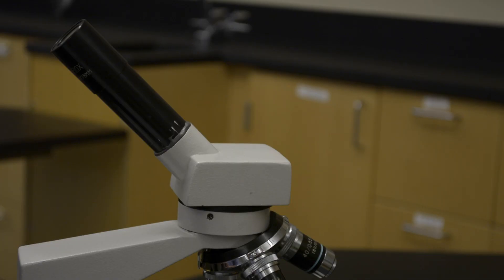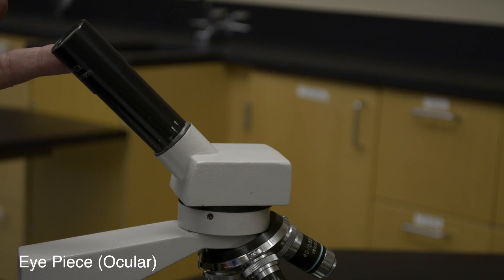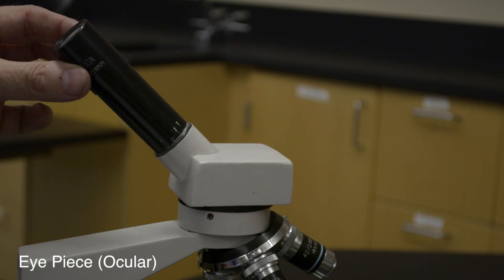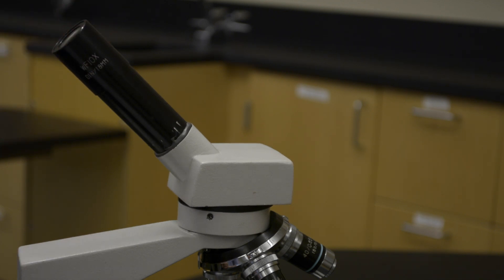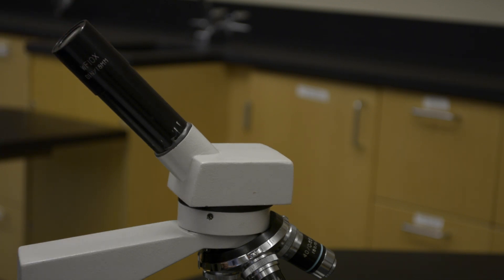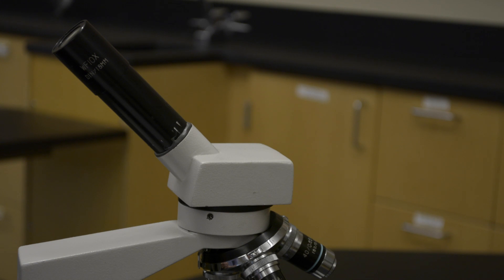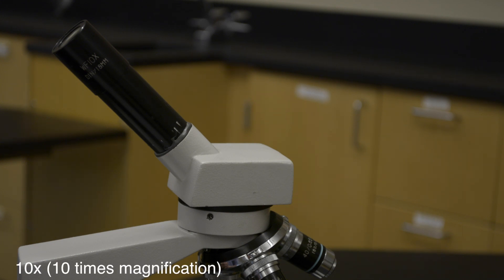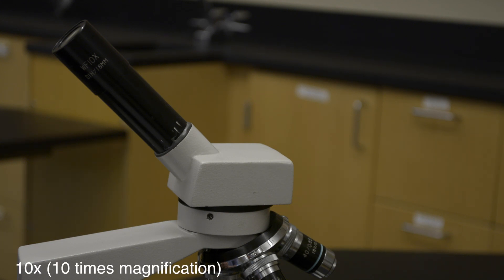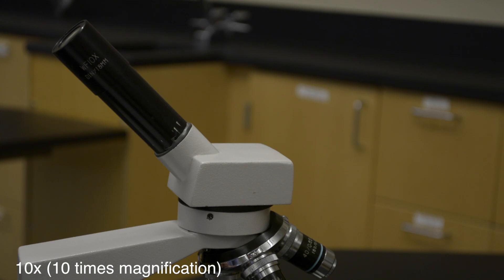The part of the microscope you look into is called the eyepiece, or ocular. The eyepiece is a lens that helps magnify what you see. It has a magnification power of 10x, which means it magnifies the image you are looking at 10 times.